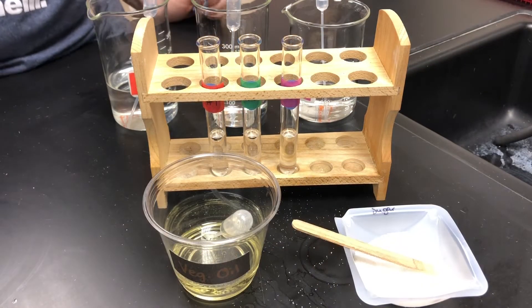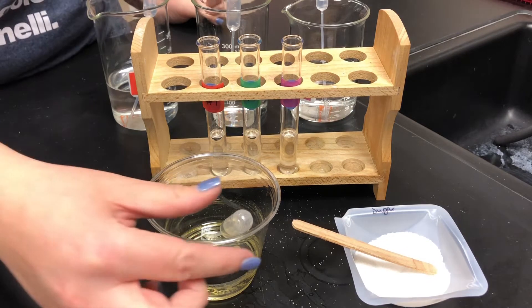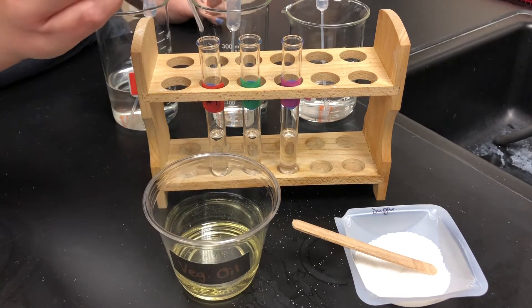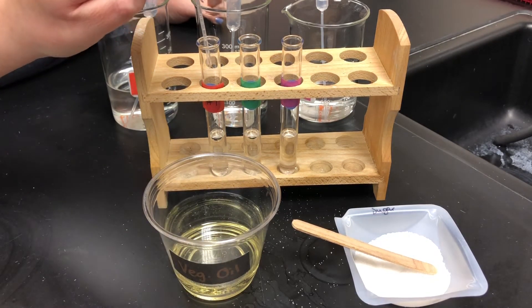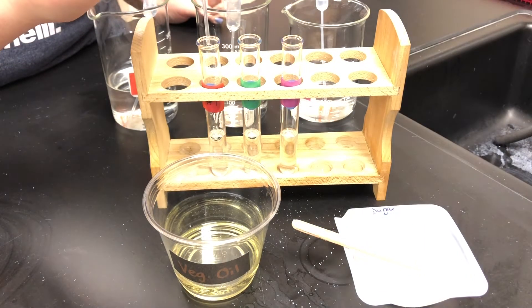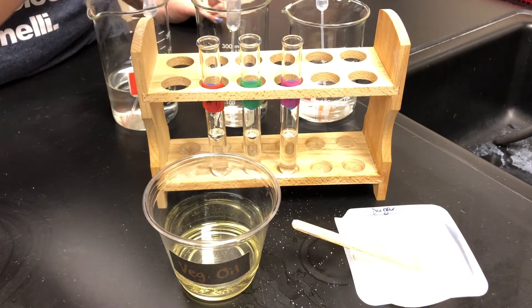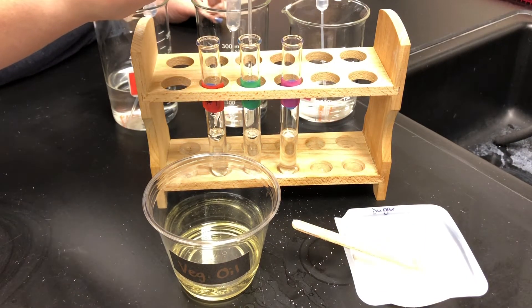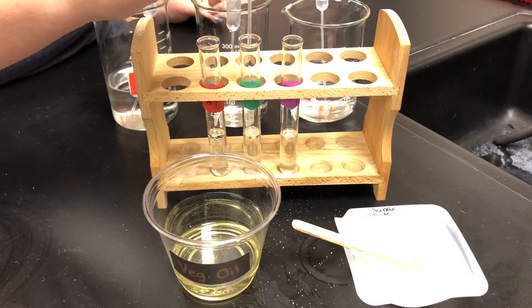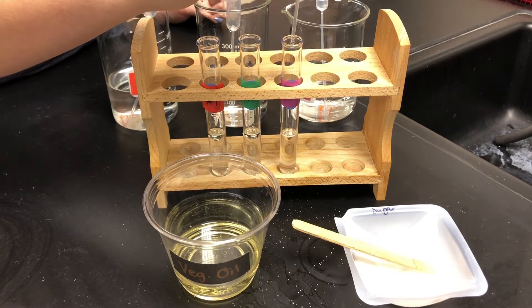We will now perform the solubility test for vegetable oil. We will place 10 drops of vegetable oil in each of the three different test tubes containing our three different liquids. We will then shake each test tube for approximately 30 seconds and then observe the results.